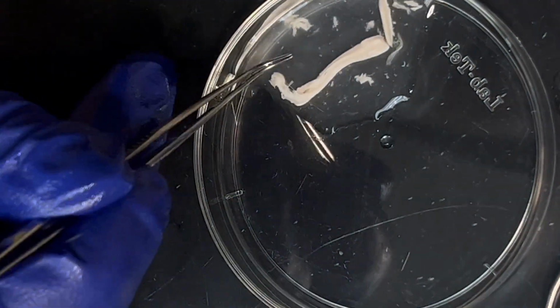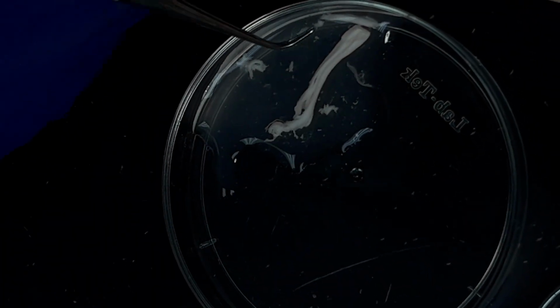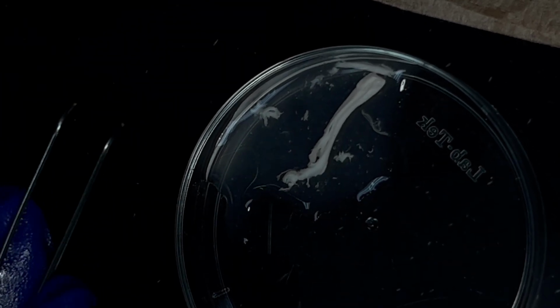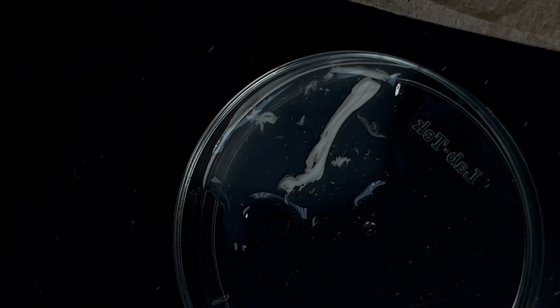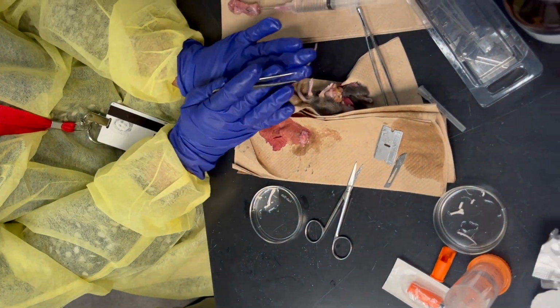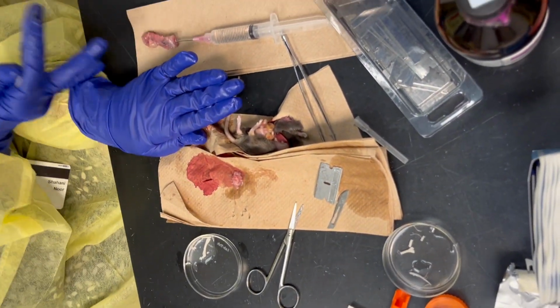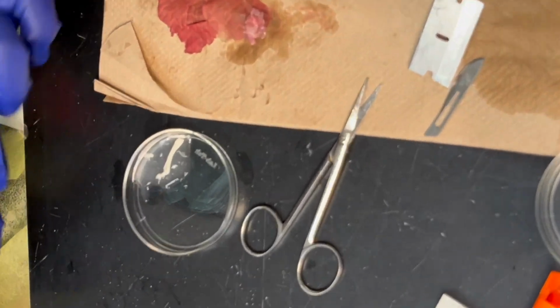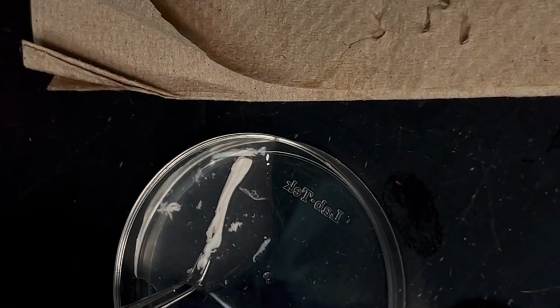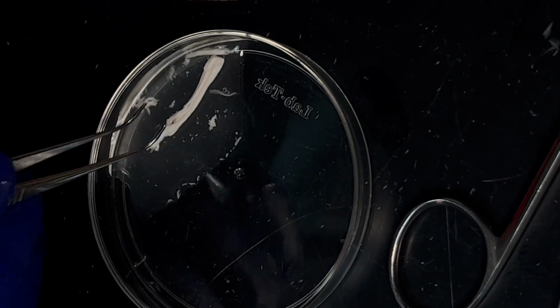I just wanted to show you where things are. But here again, that very white line marks the dorsal part from the ventral. I have shown you how different that is. So if you know the dorsal and ventral, the only other thing you need to know is which side was the sciatic nerve. If the mouse is like this, then this side is your CCI side, and this is your control side. So it's a similar idea to the brain.